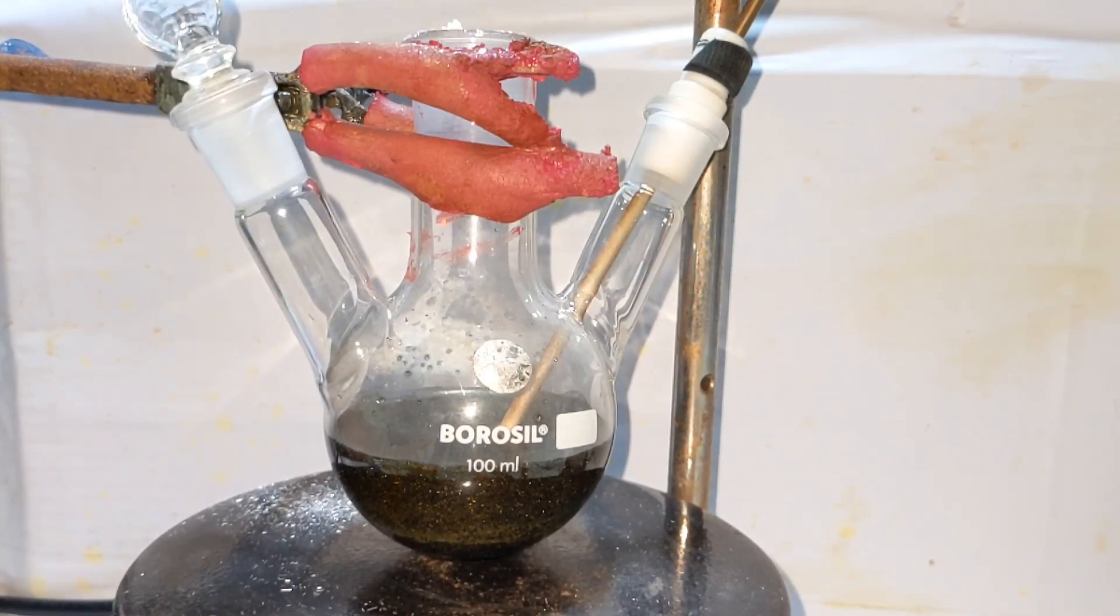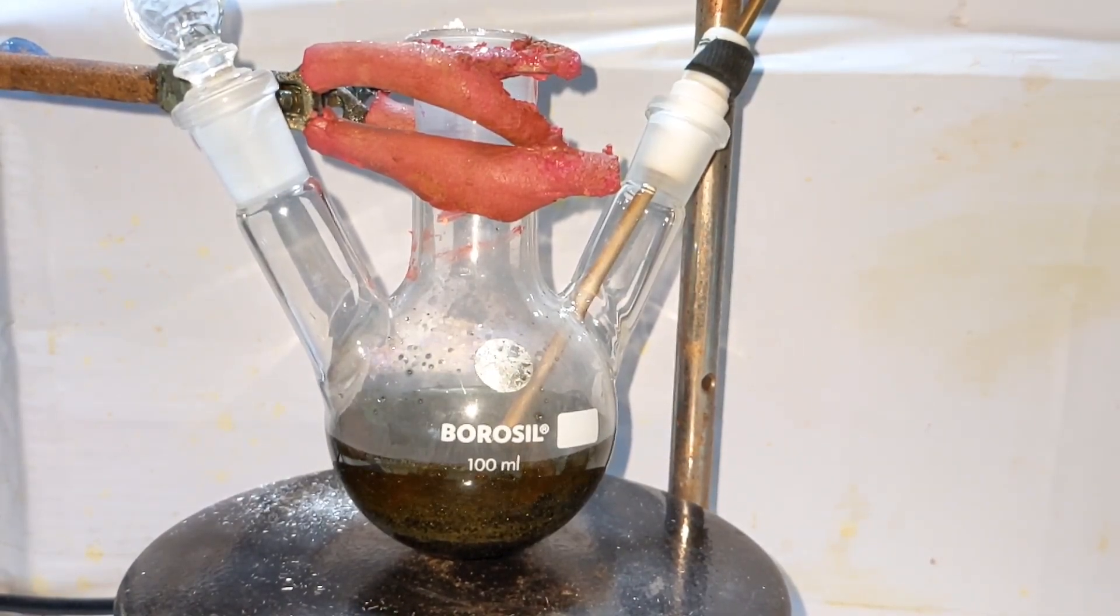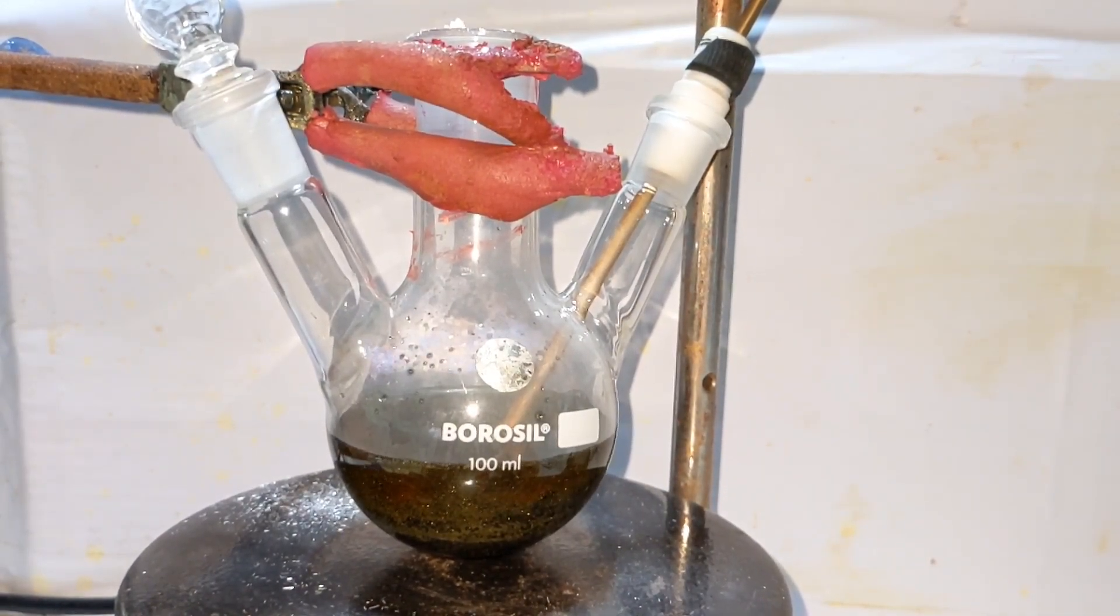After adding that, start stirring the mixture. Immediately you observe a color change. A dark red color, almost black color, is obtained.